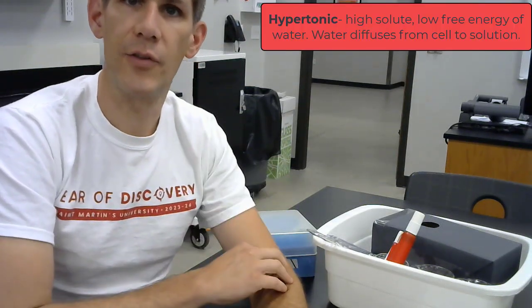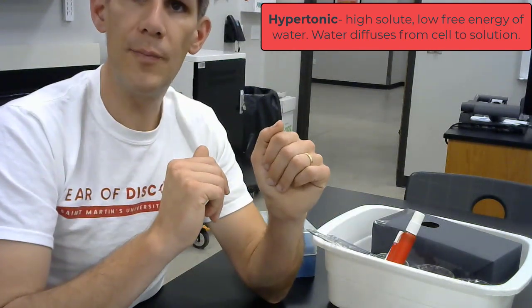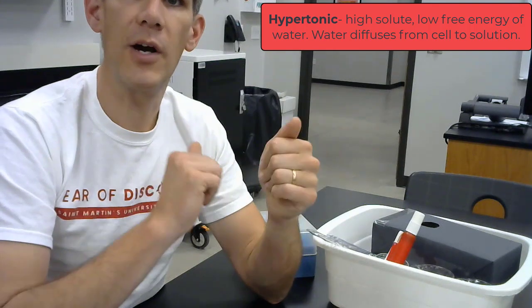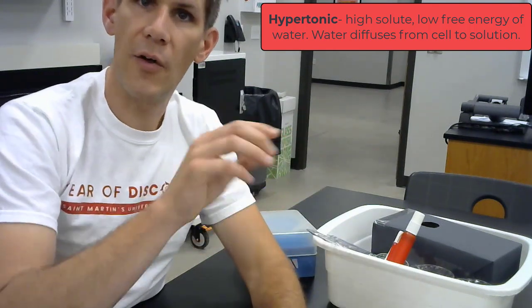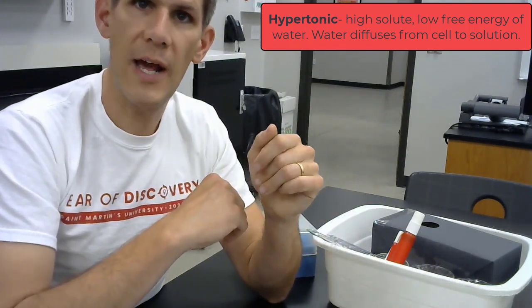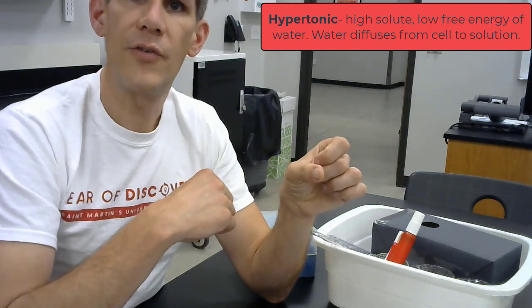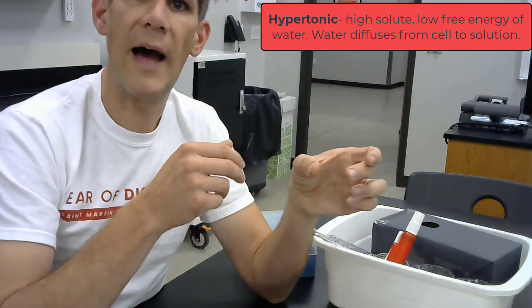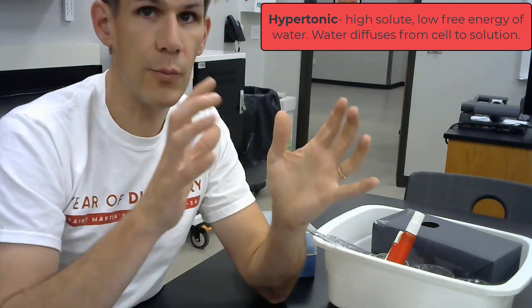One solution is going to be a hypertonic solution. Now this is important to osmosis because osmosis is the movement of water in and out of a cell. In a hypertonic solution, there is more solute in the solution, and what's going to happen is the water in the solution has lower free energy than the water in the cell. So water from the cell will move out into the solution. We can expect that the potato in that solution will get smaller.